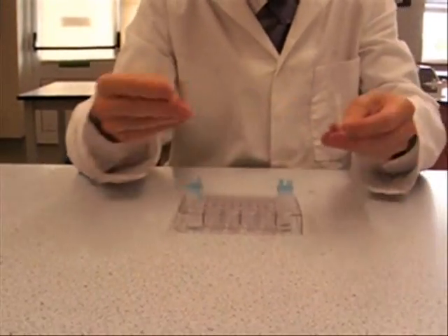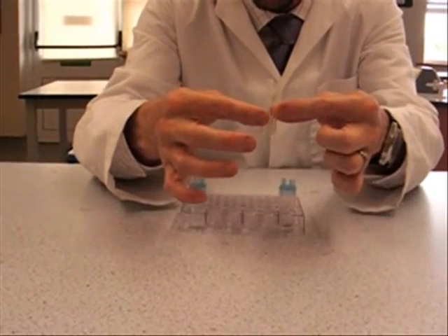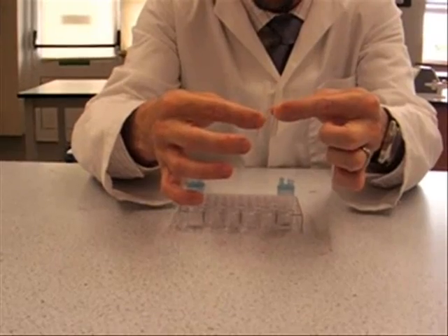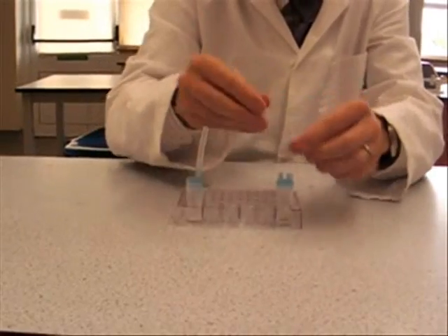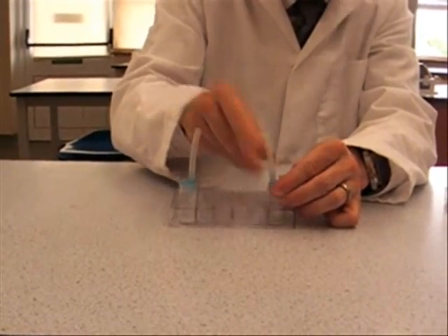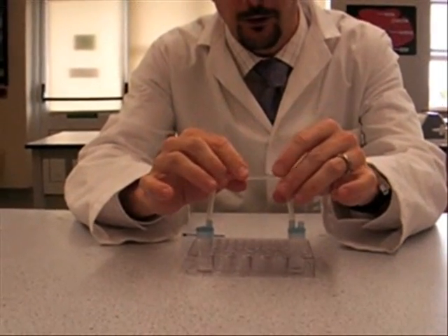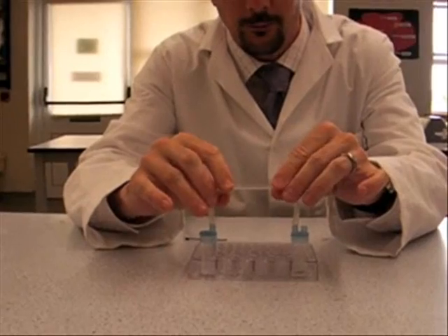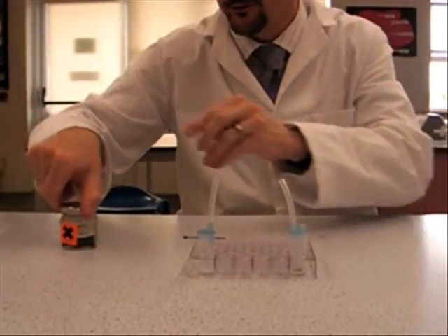And this is where the two bits of rubber tubing come in. There are three bits of rubber tubing. You want two that are two shorter ones. One goes on here, one goes on here. And then, these two bits of rubber tubing are going to be holding this glass tube in between.